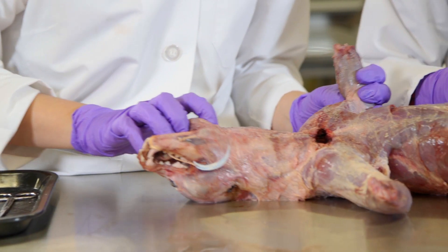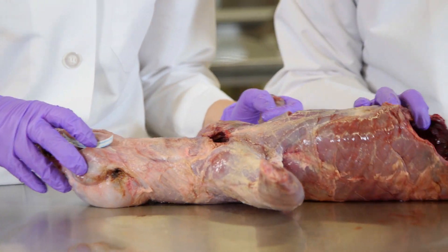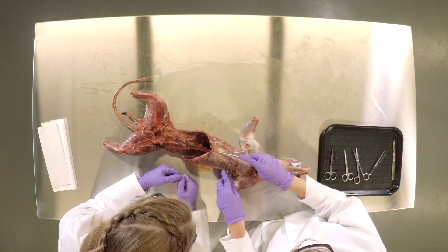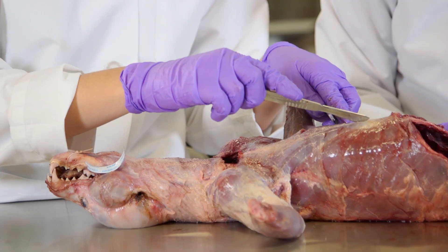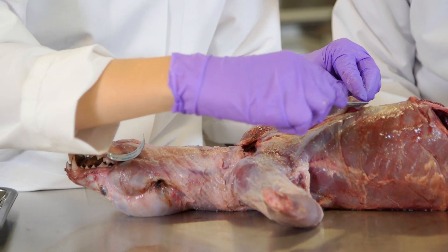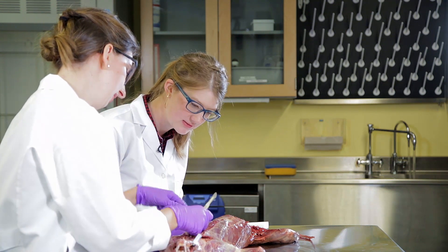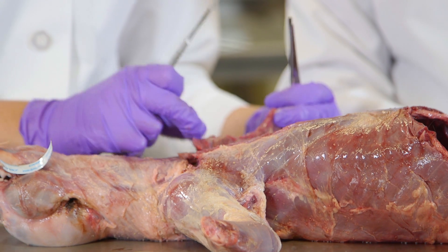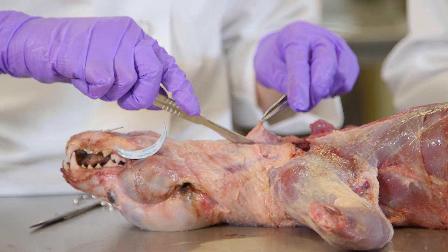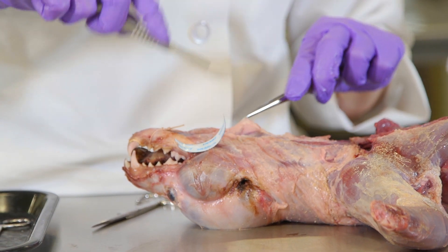We'll start with a forelimb. First thing we're going to do is remove a forelimb — we're going to cut down the midline along the pectoral muscles to loosen those up and release that connection. That was the pec major that we just retracted. Now I'm going to cut through this connective tissue of the neck so that we can remove the connection with the forelimb.